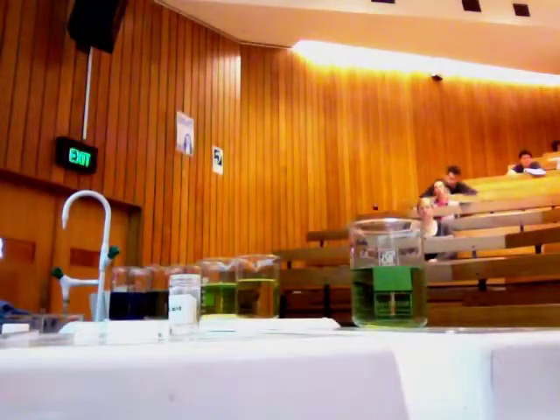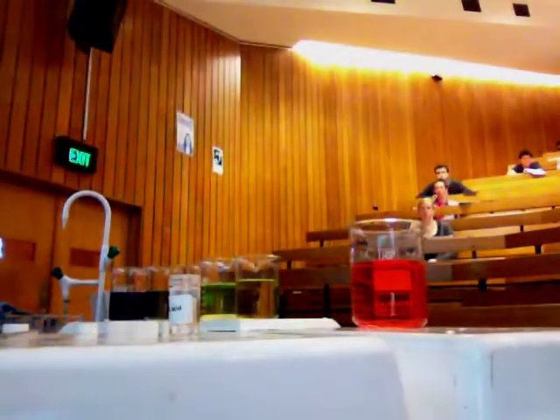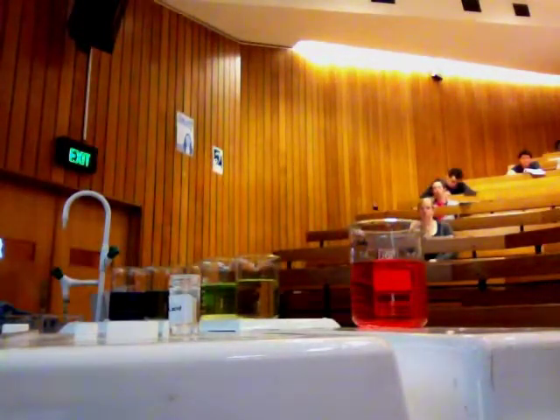Here I've got just some water and I'm going to add in some HCl. So there's a big change in the pH — four units change in the pH just from the addition of that 25 mLs I put in.